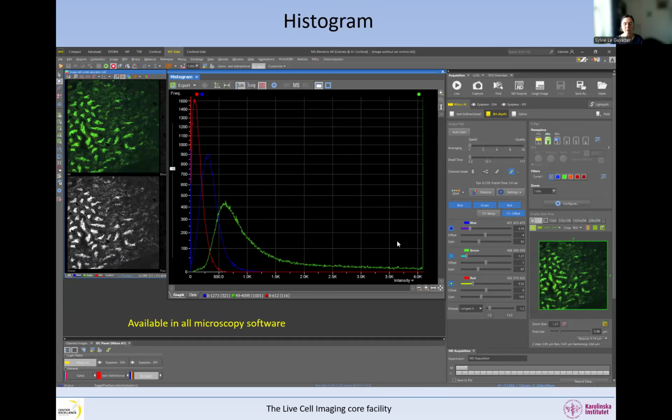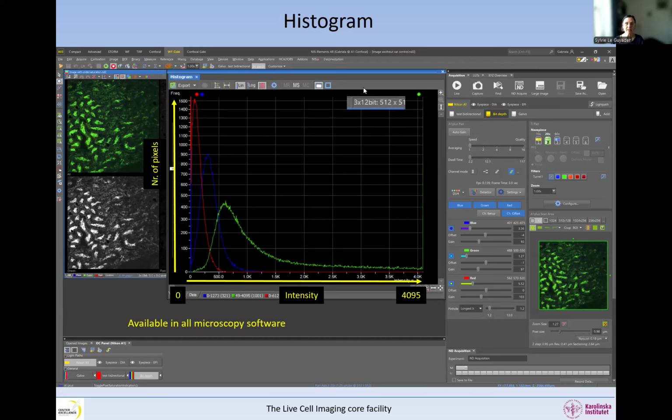So that was the lookup tables. And if we look at the histogram here, this is also available in all microscopy software. You can see here on the x-axis all the possible intensities in this image, so from 0 to the maximum of the bit depth. And here you see the number of pixels across the image that have this intensity. So here we see this is a 12-bit image, and so there are 4096 levels of gray from 0 all the way to 4095.